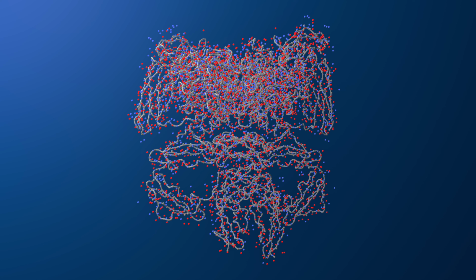To submit your job, head over to the Kihara Lab EM server at em.kiharalab.org. Scroll down to the Roadmap section and select DeepMainmast. Now this is where you will upload your files. For the Cryo-EM map, just upload the file in this field.